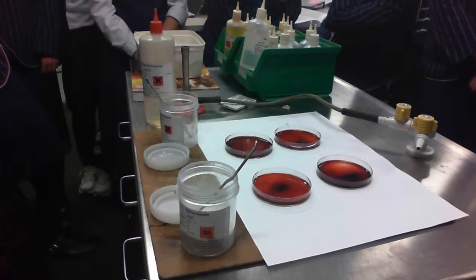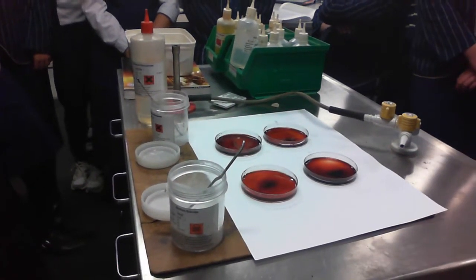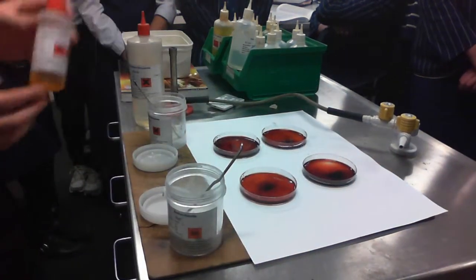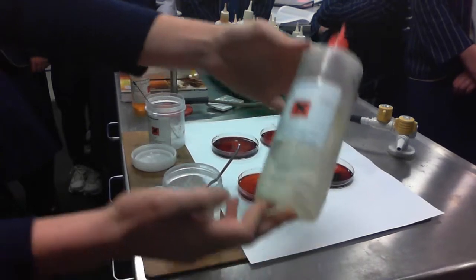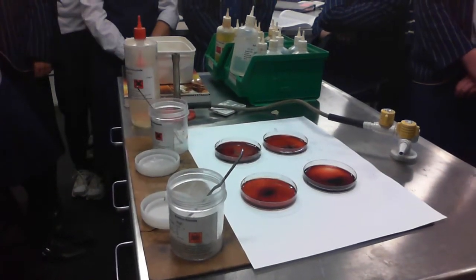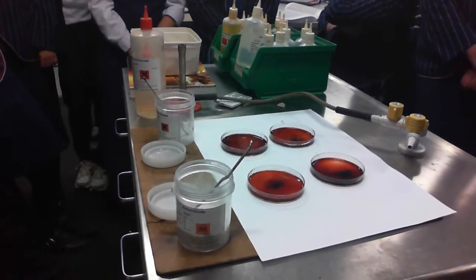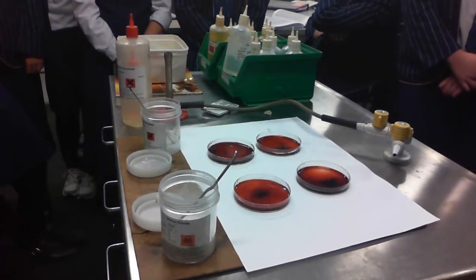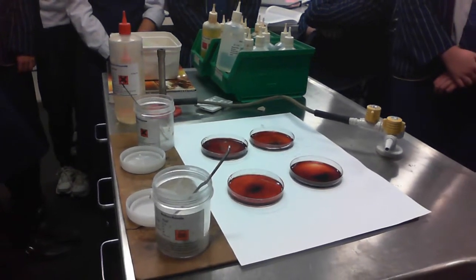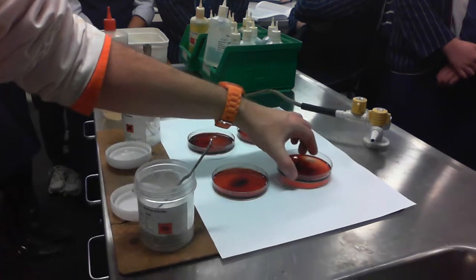In this video we're going to be looking at an equilibrium system using which two chemicals? Iron 3 nitrate and potassium thiocyanate. Well said. These two chemicals, when they react, make an equilibrium reaction, becoming the FeSCN2+ ion, which is a complex ion, so we put square brackets around it. And you can see it makes this really cool blood red colour.